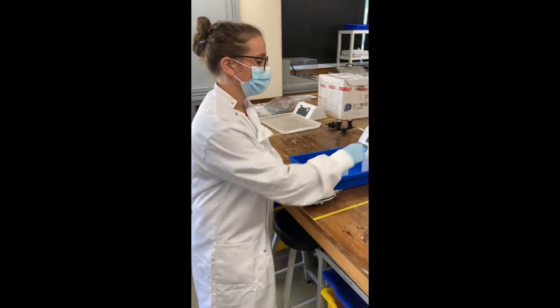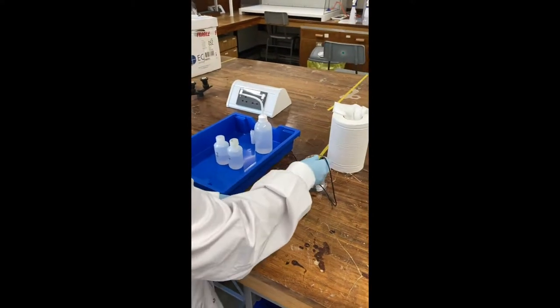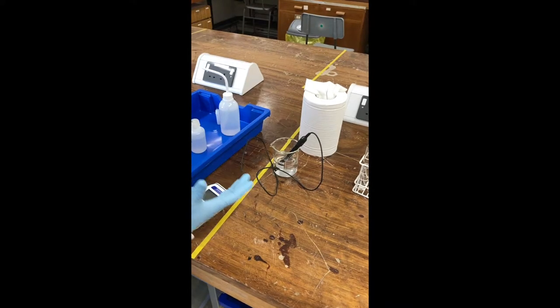I'm going to show you now how to use a pH meter. So with the probe, it must always stay in the liquid, otherwise it will dry out and it will break.